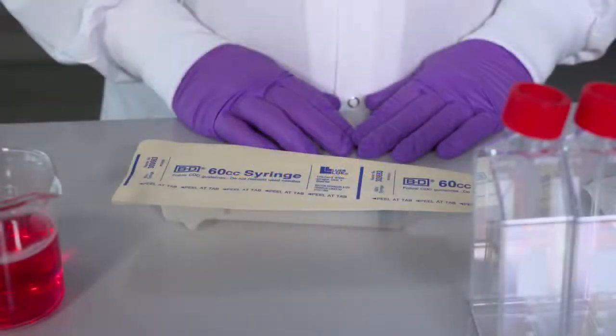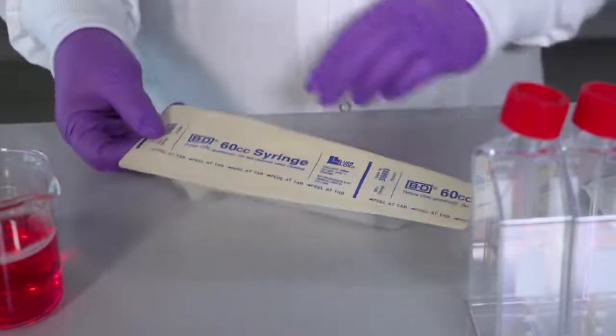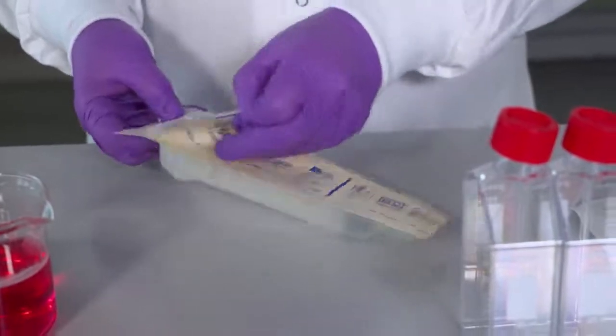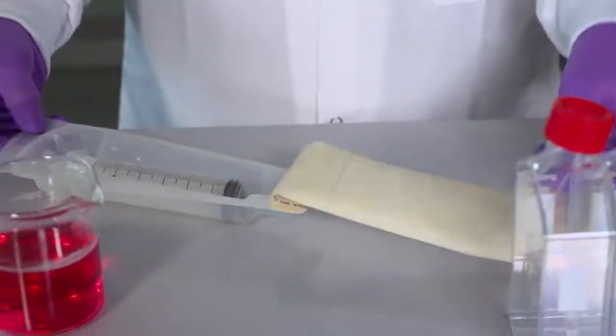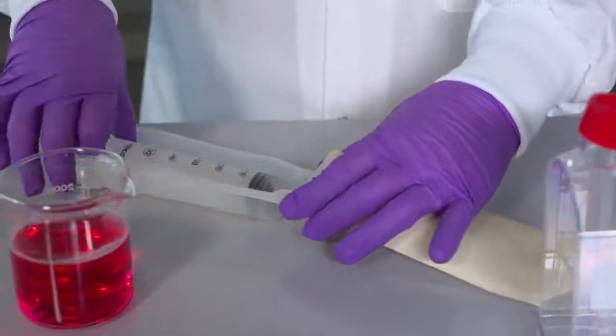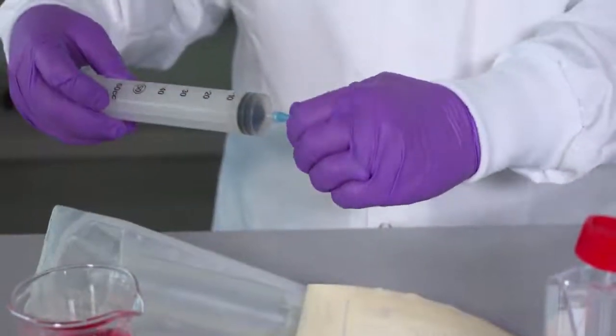System setup. The Sterivex filter units can be connected to a syringe greater than 10 cc or repeating syringe and proceed with positive pressure, peristaltic pump or pressure vessel.